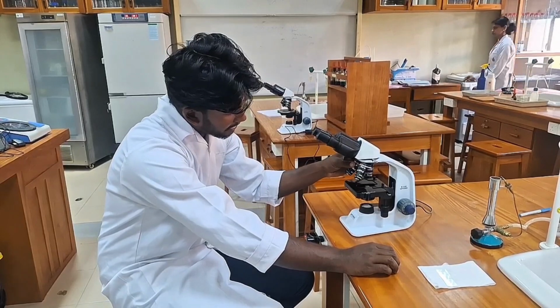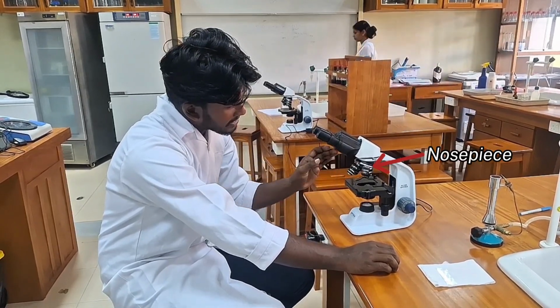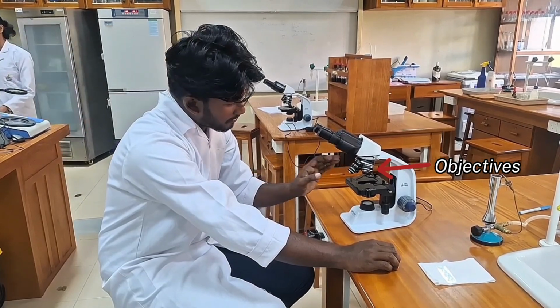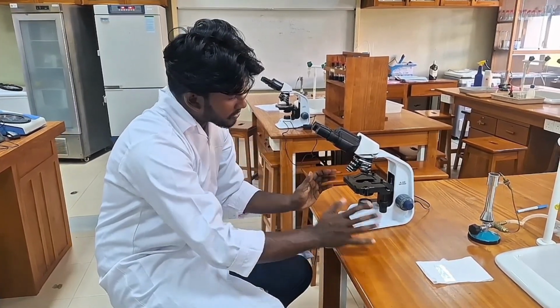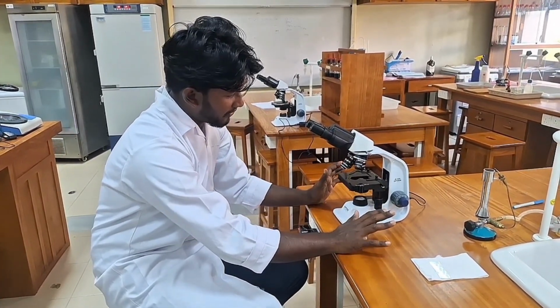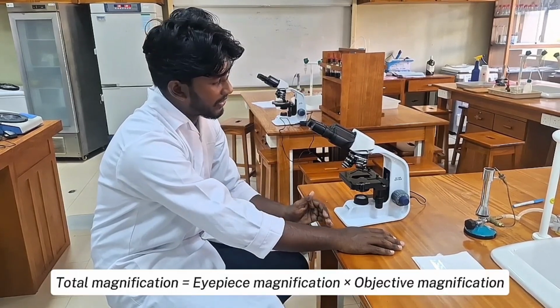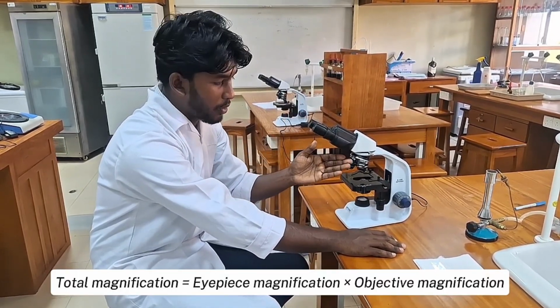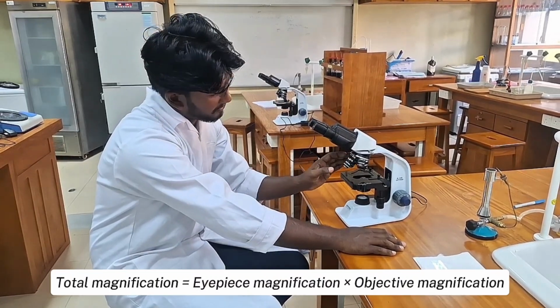Here we have the revolving nose piece. It contains 4 lenses in this microscope, which we call objectives. Objectives have different magnification levels. The total magnification is calculated by multiplying the eyepiece magnification with the objective lens magnification.